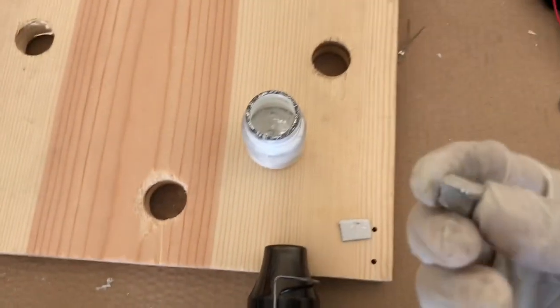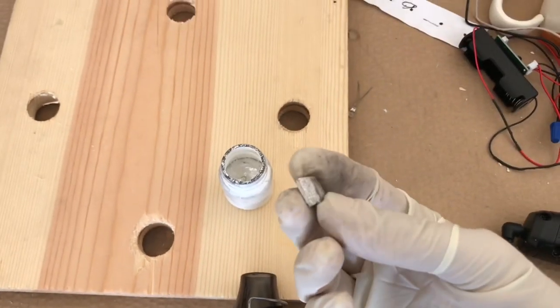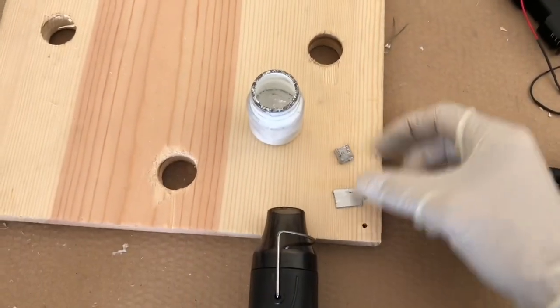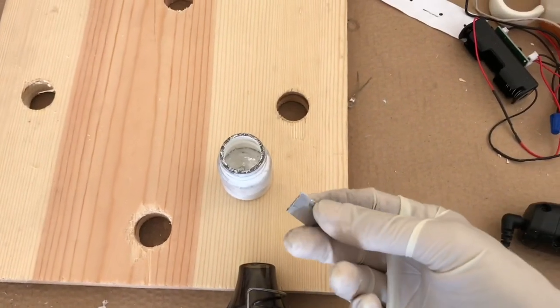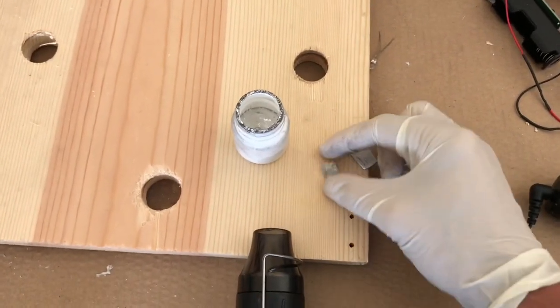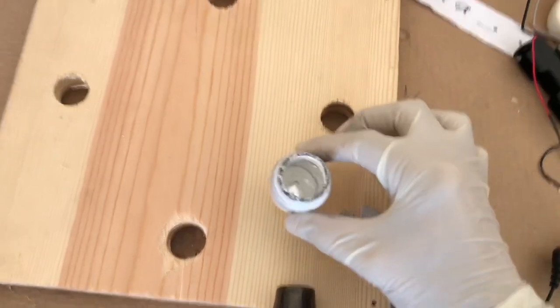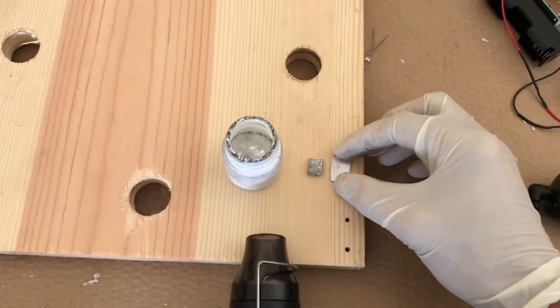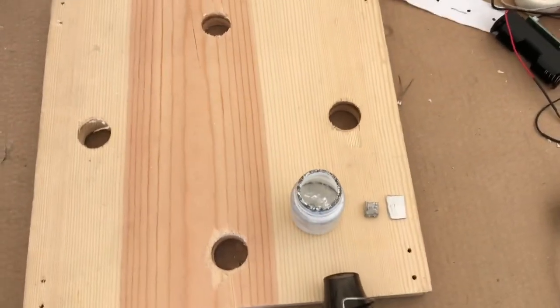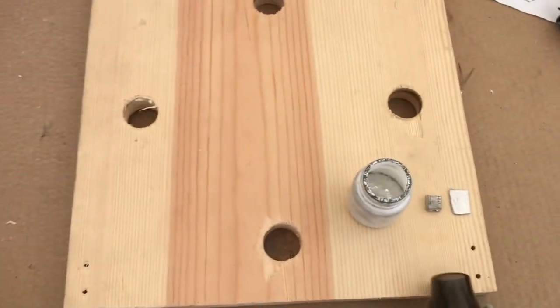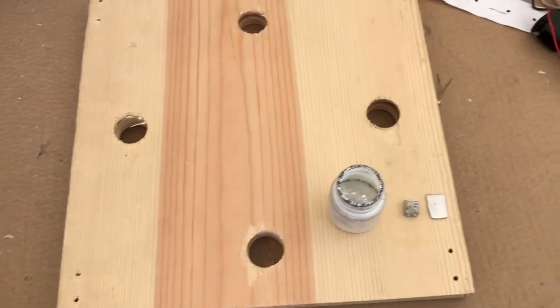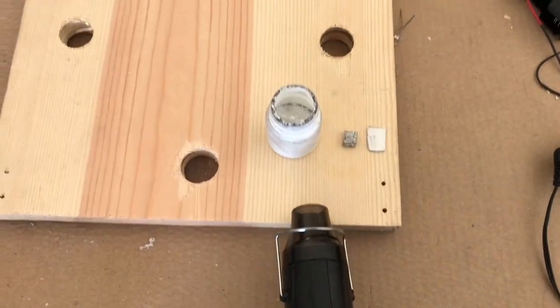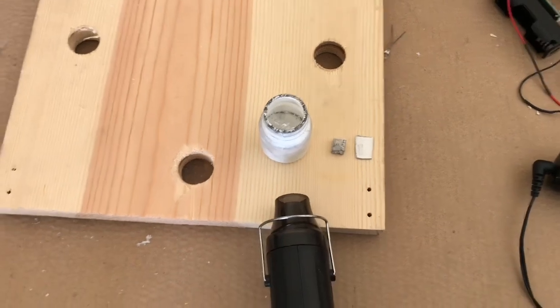In this video I have a small piece of magnesium metal here and a second piece of aluminum metal here. I have some gallium here which I'm melting so I can put a drip on the aluminum and on the magnesium to compare how these things interact with gallium and how reactive they would be when they're placed in water.